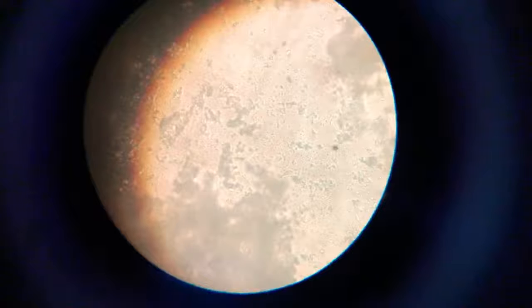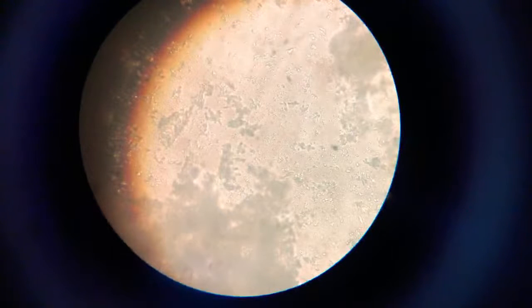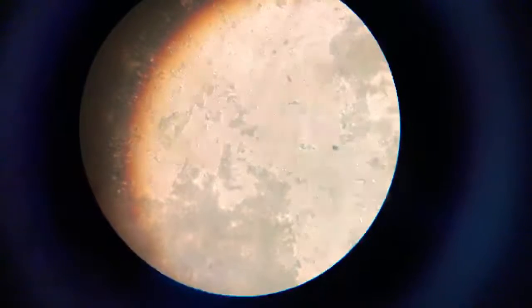So this was it, sir. One of the few amoeba that I have seen in my entire life. Now I will start with something new and I'm already preparing another culture.